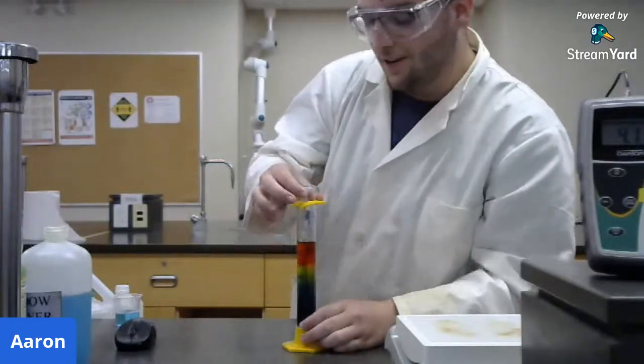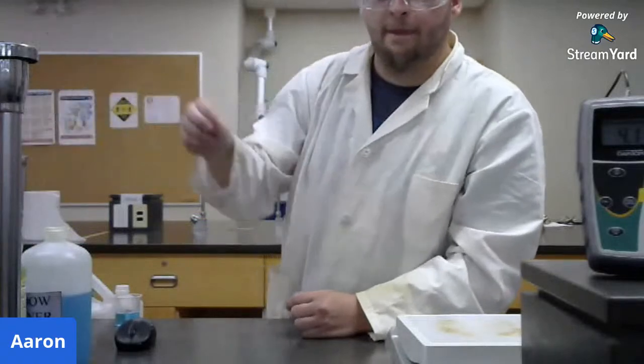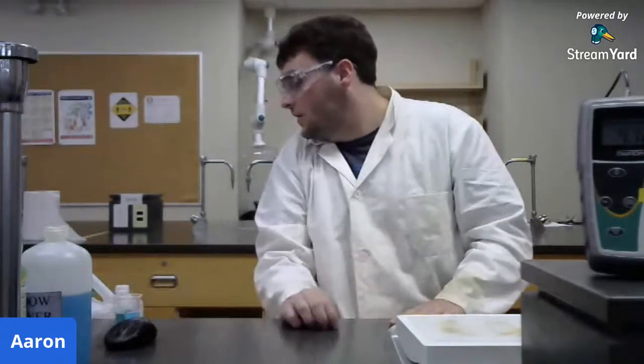Everybody enjoyed that one, it seems. Awesome. So that concludes our little demos for today. Now I'm just going to stick around if anybody has any questions or any more suggestions. I have a few more chemicals here, and I have some more tubes if you guys want to see some more color changes.